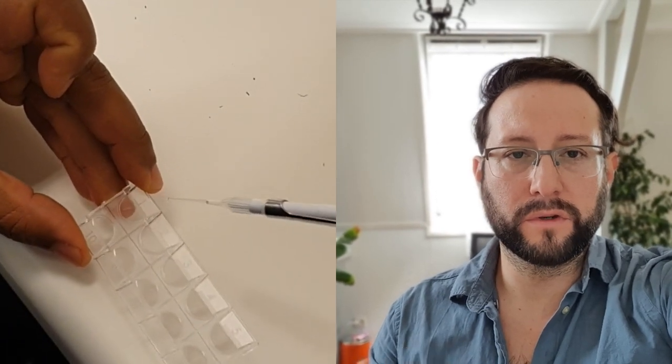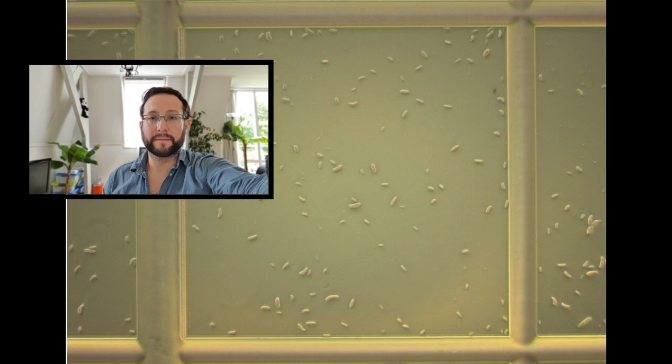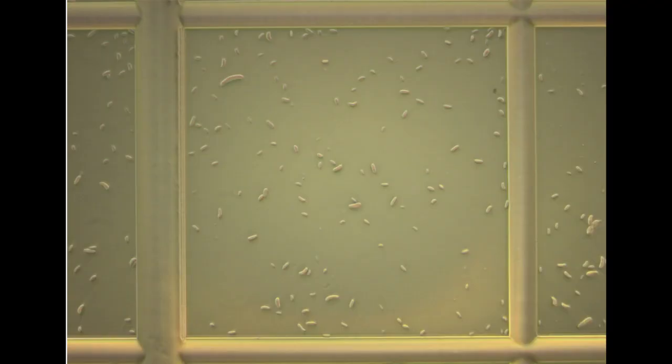As I mentioned before, what you need to do is to take 10 microliters of your inoculum, use the slides, and then observe under the microscope. Make some pictures. If the microscope doesn't have a camera, just use your phone to make some pictures, or you can actually count here, but I will show you how I do it. So I make pictures and then I go to the computer. It doesn't matter which software you use, just open your graphic editor, ImageJ, GIMP, even Paint or Photoshop. Just open your pictures and start counting.